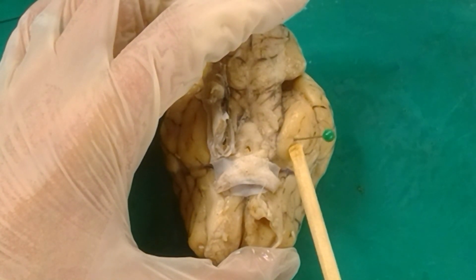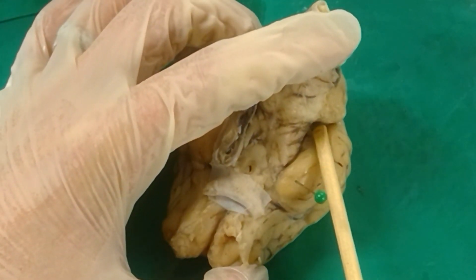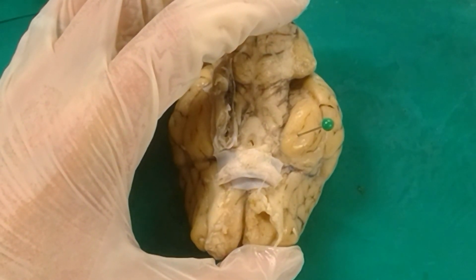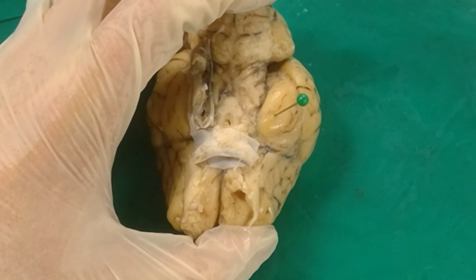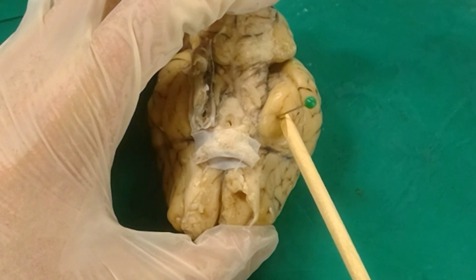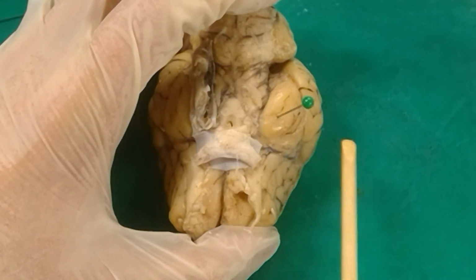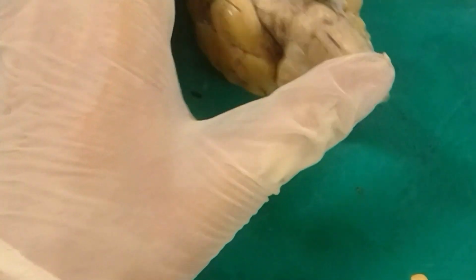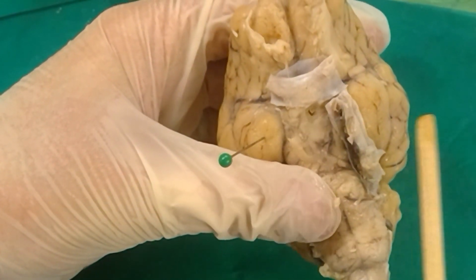So the amygdala is sitting right at the end of the hippocampus. The hippocampus would normally be extending back along that way. We can't see it because we're looking at cortex, not the actual inside of the brain yet. The hippocampus sits just inside the cortex, with the amygdala right at the tip of where we see this gyrus. So if we were to cut through the tissue right here, making a coronal cut and looking at it head on this way, this would be going right through the amygdala right there.